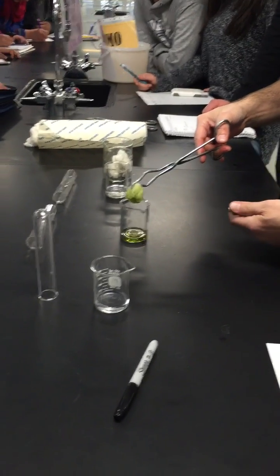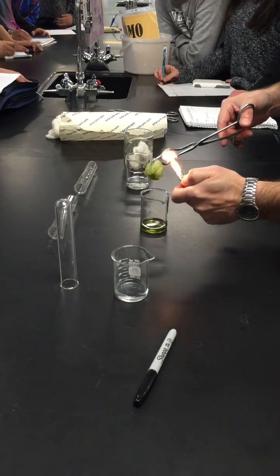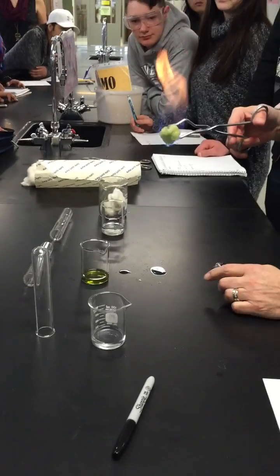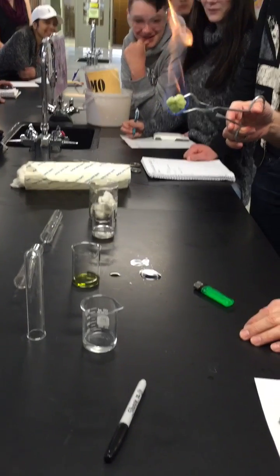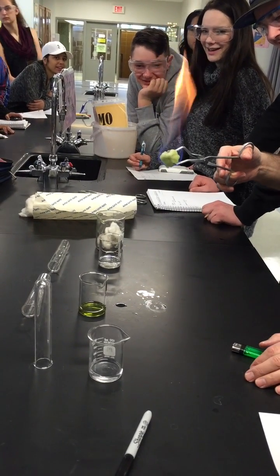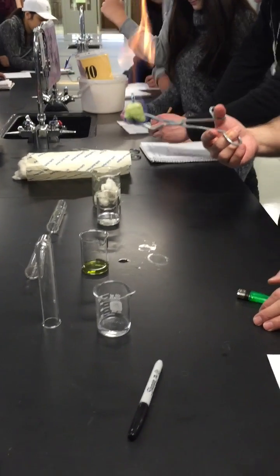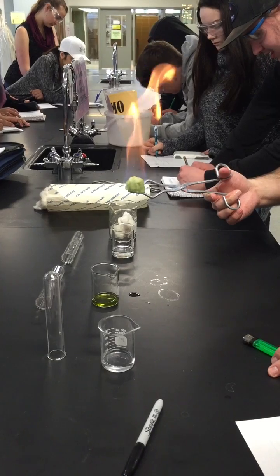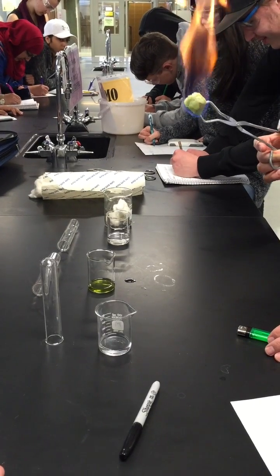What do we expect now? More yellow? More orange in there, less complete combustion? So we've got the blue showing that we do have some complete combustion down there, but we do also have some incomplete, and therefore we have the orange. We got that on video? We're going to get wet now.